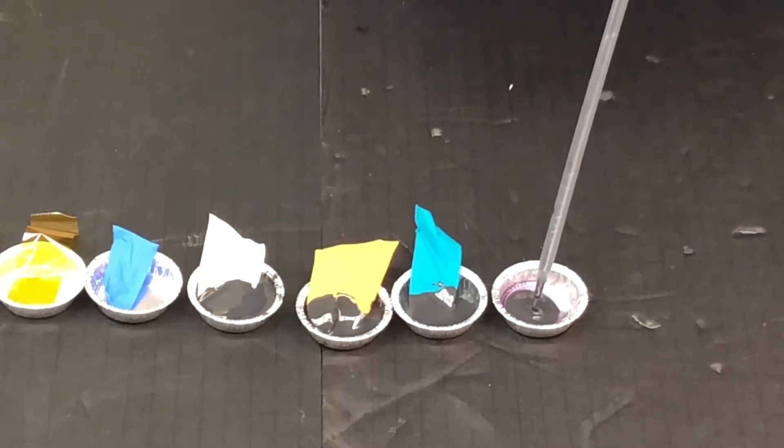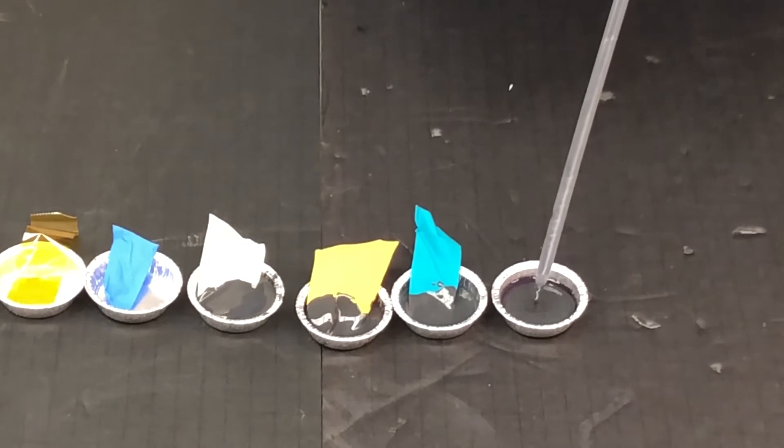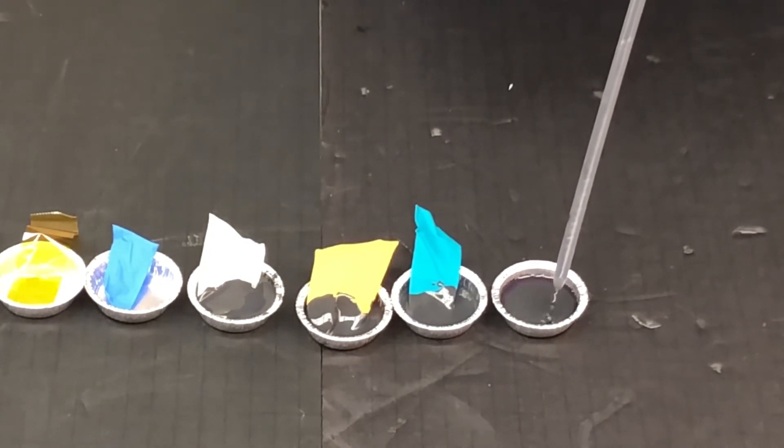However, it's best practice to use the material you are using on site, as platinum catalyst amount and cure inhibition sensitivity can vary by product. Fill up the tin so that it covers the portion of the sample that is touching the tin, but leave some of the sample uncovered to compare.